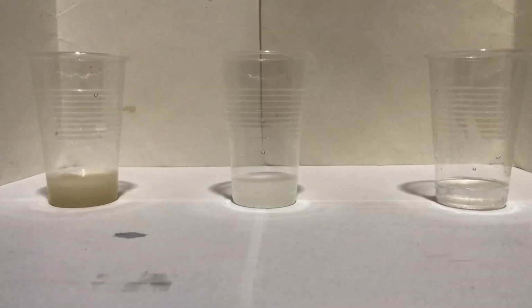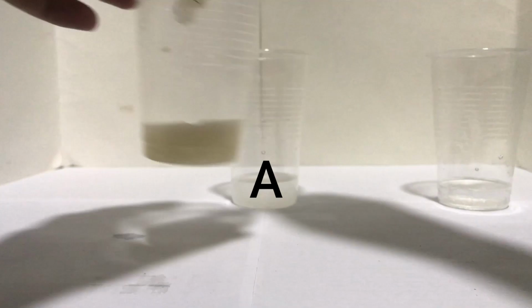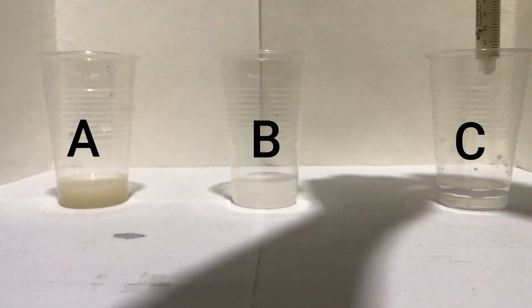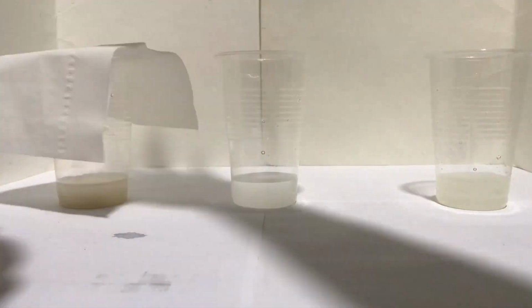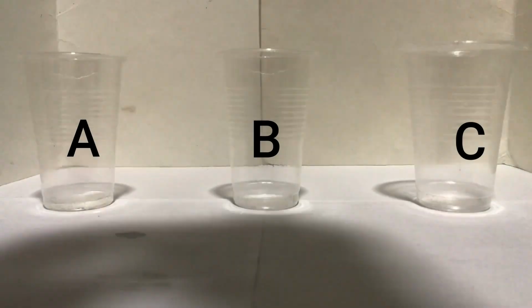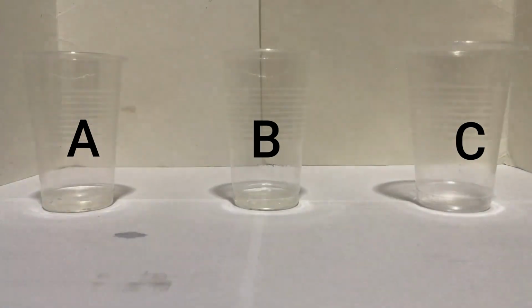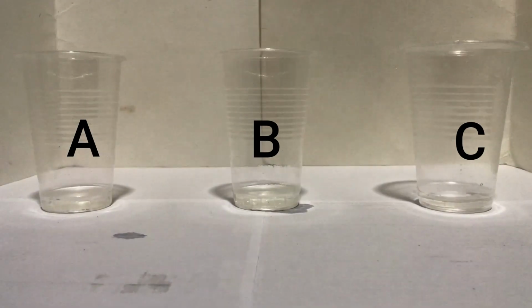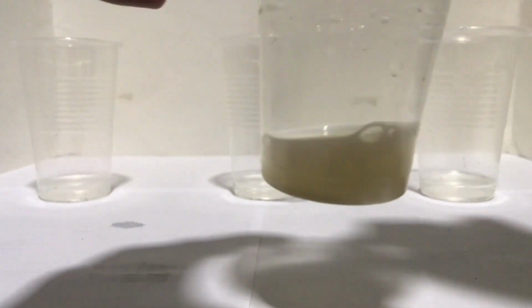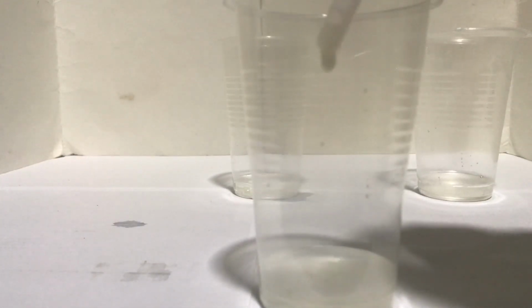In the third cup, put 5 ml of solution A into 20 ml of water. This will be solution C. After setting up the solutions, cover the cups. Now, using a syringe, prepare 3 uncovered cups labeled A, B, and C, with about 15 milliliters of hydrogen peroxide each. Using the 3 covered cups labeled A, B, and C, quickly add 15 drops of each solution to the matching cups. After adding 15 drops each, observe the reaction for a few minutes.